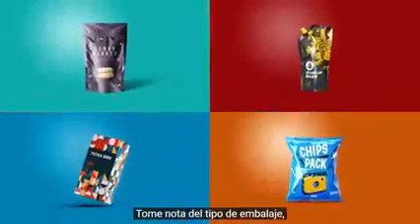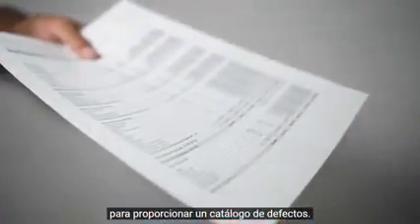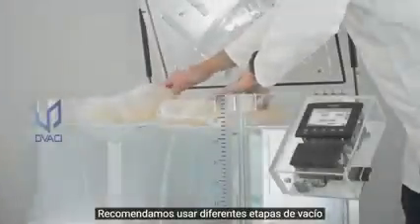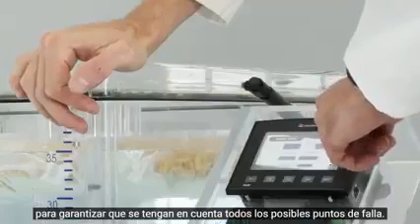Take note of the packaging type, like mono or multi-layered packages. Each material is usually tested by its manufacturer in order to provide a defect catalog. This catalog might be useful during this test. We recommend using different stages of vacuum to ensure that all possible points of failure are accounted for.